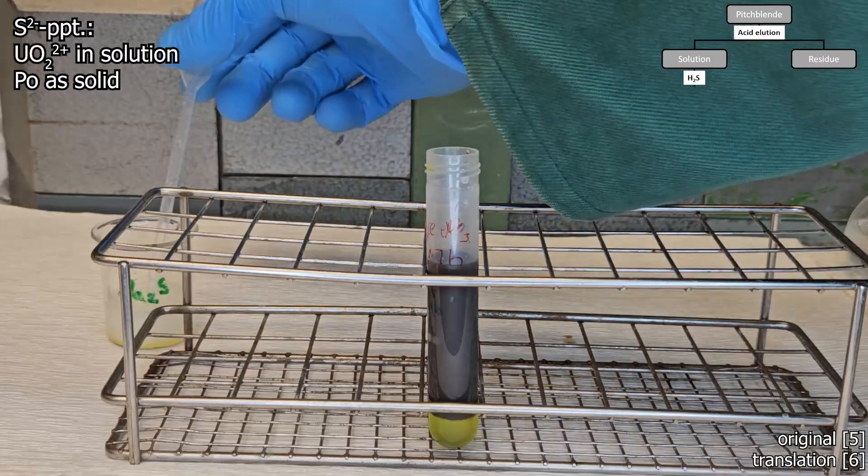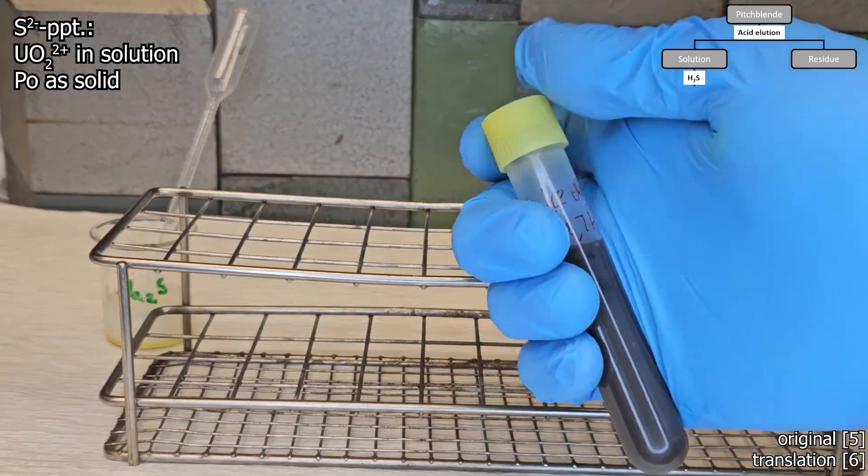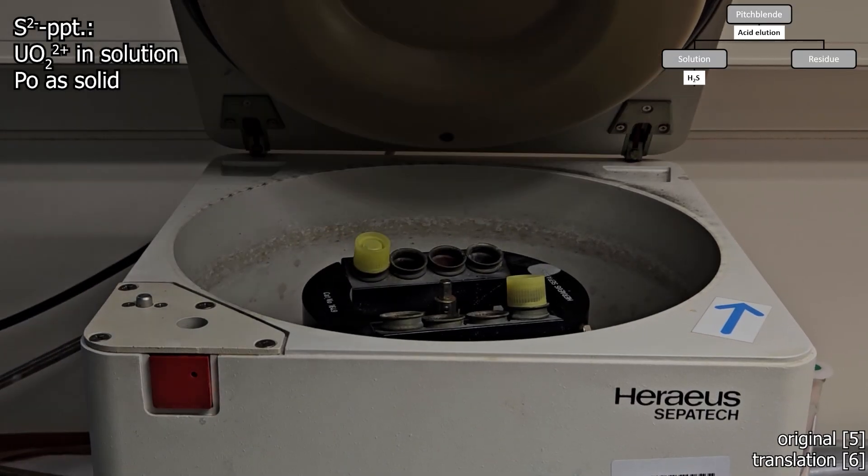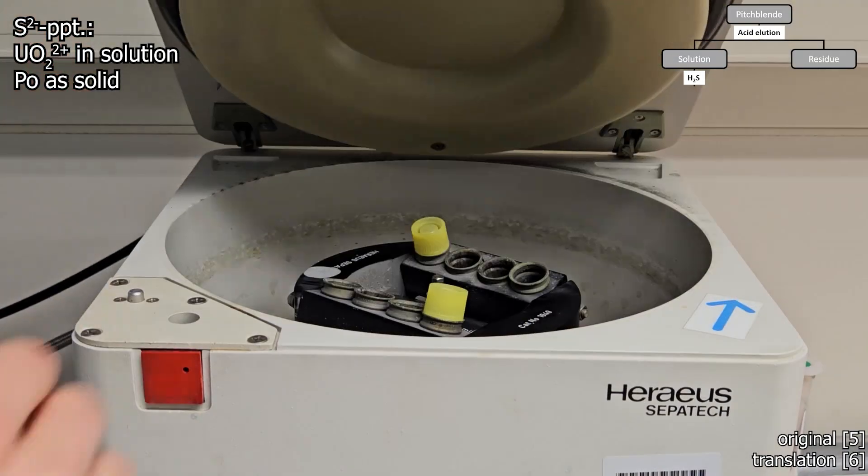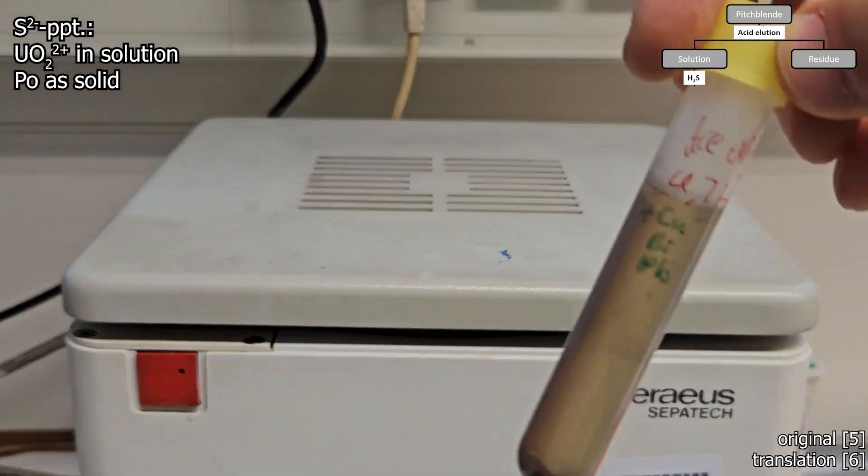In my setup, I'm simply using sodium sulfide solution, but more or less the same. The precipitate must be thoroughly centrifuged. More sodium sulfide is added until nothing more precipitates.